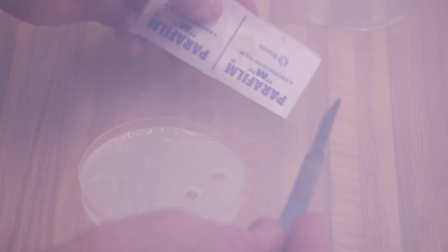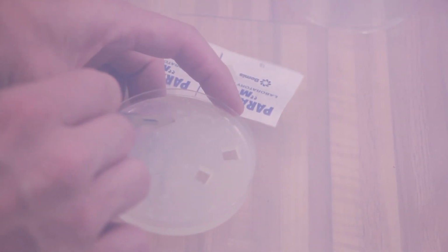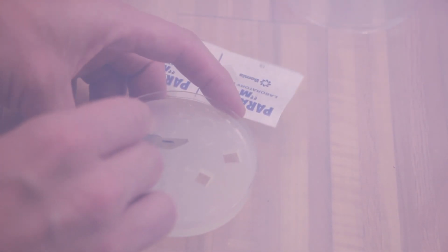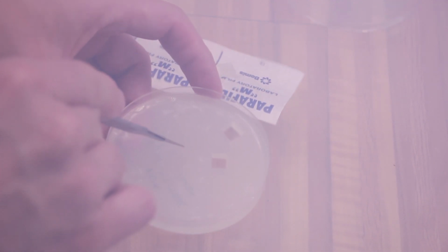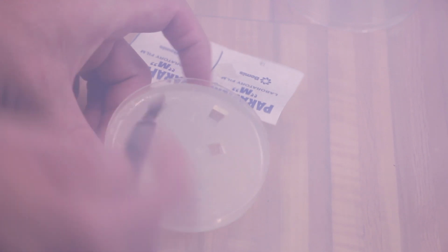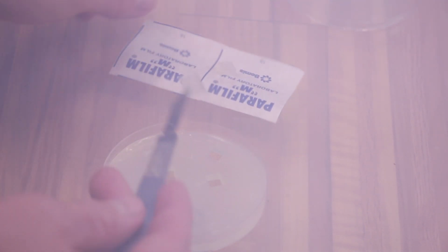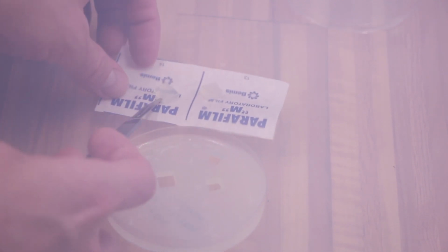But as you can see, I'm not taking all the precautions. I didn't bother putting gloves on, and I didn't even spray anything down on the inside. I ran out of rubbing alcohol and I've been too lazy to go to the store and get more. So I'm taking, we'll call it, very moderate precautions here to not contaminate my pink oyster.